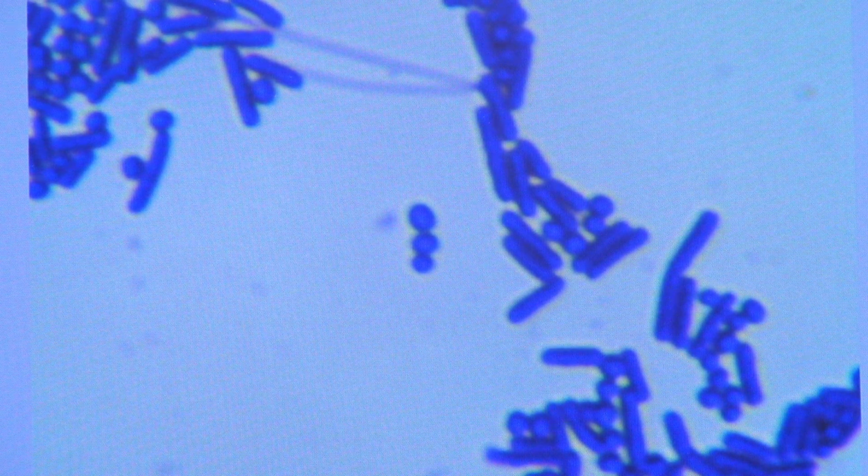And just a little bit of tweaking goes a long way. I mean, with my eyes, I can see this quite well, so just bear with me. It seems to have a little bit of a lag on the screen. And I know that you also will be dealing with this when you're trying to get your microscope. There we go. Oh, just a little bit better.